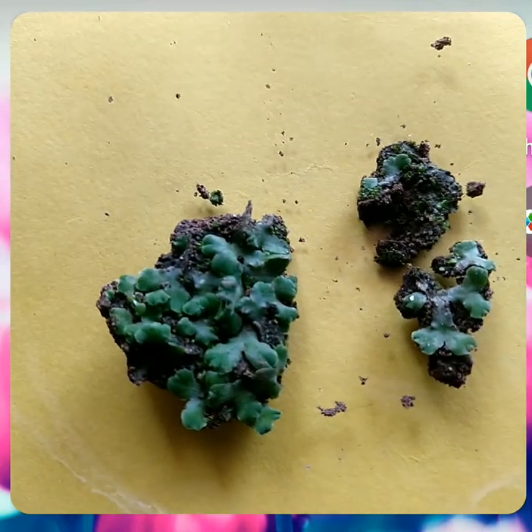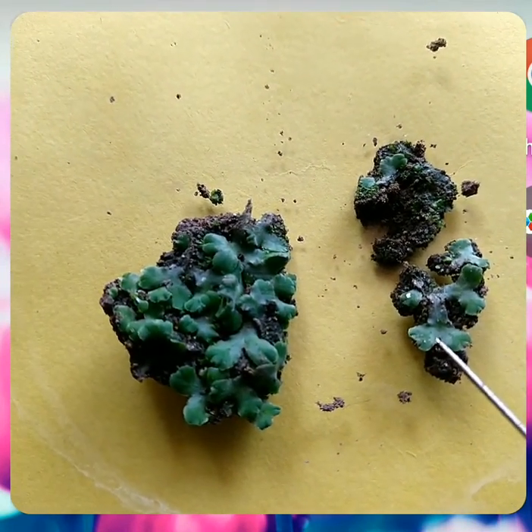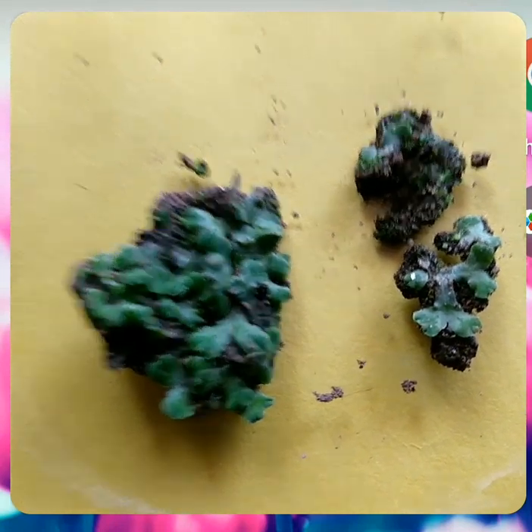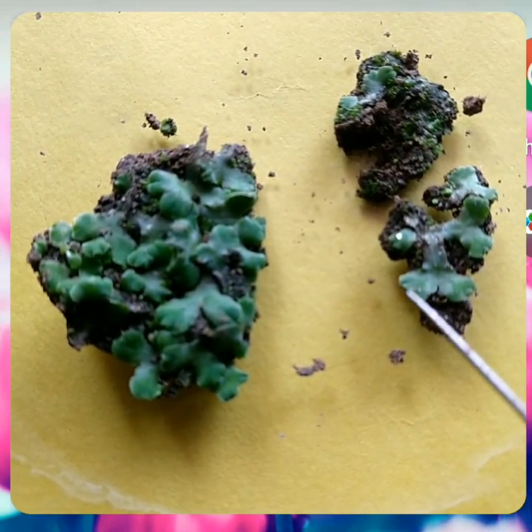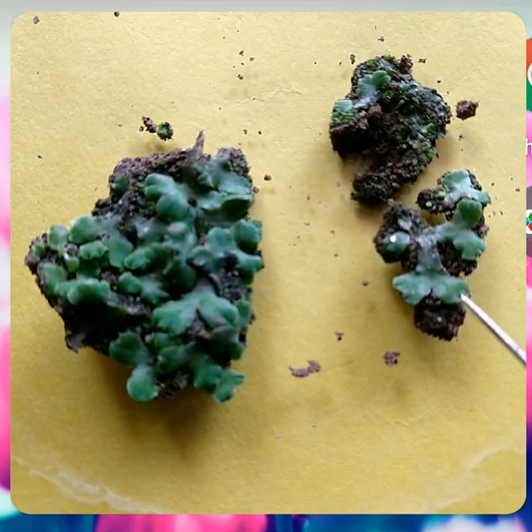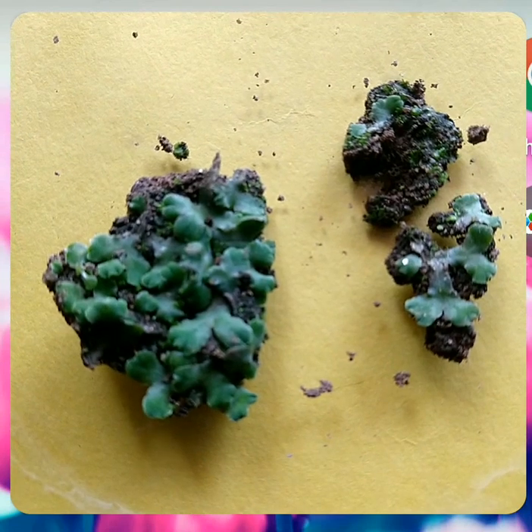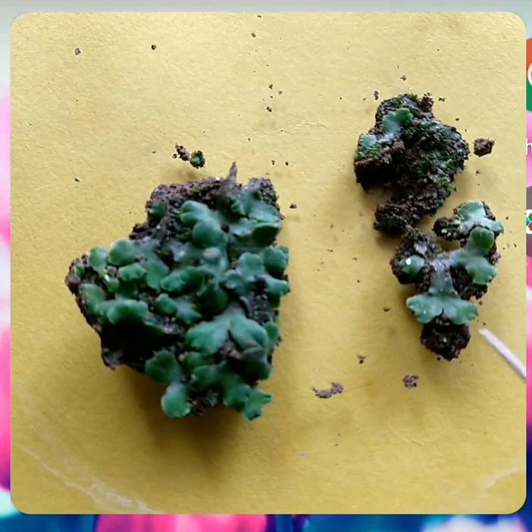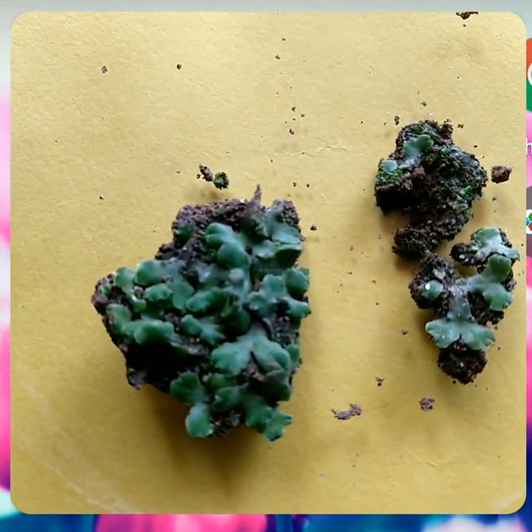The thallus is linear in nature — ribbon-shaped and wedge-shaped with an apical notch. The apical notch is the growing point; you can look here — this is the apical notch, and it is the growing point of the thallus. The apical notch is present at the tip of the thallus lobes.